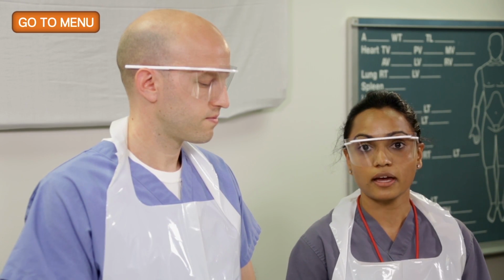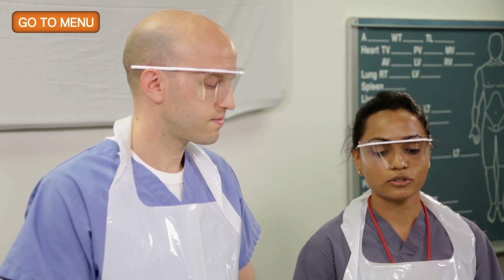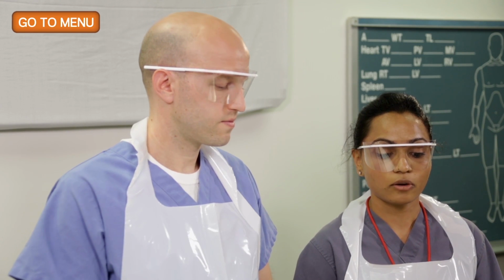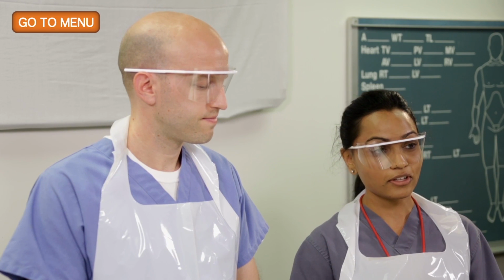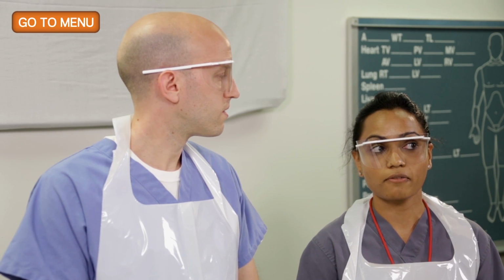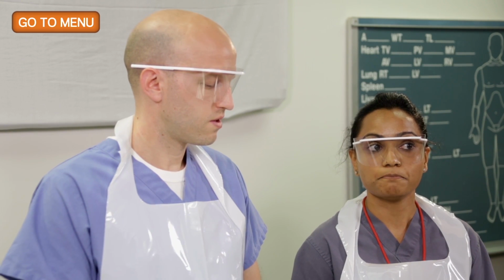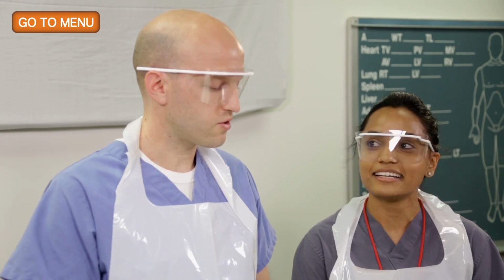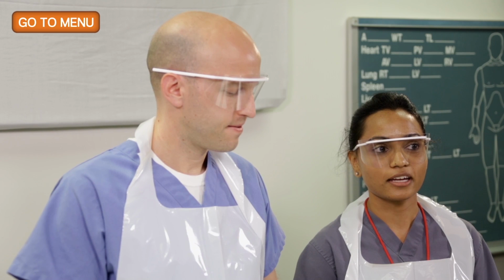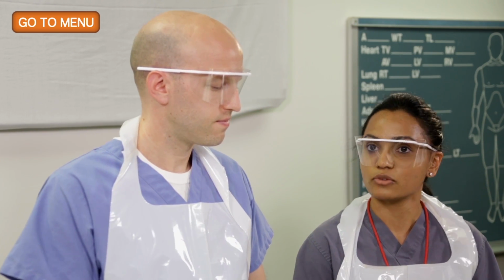Versus in a patient that has a history of coronary artery disease or hypertension, we usually bread loaf the heart so that we can evaluate the myocardium and look at the thickness of the ventricle. And then also we want to thoroughly evaluate the coronary arteries, so we dissect them entirely and take them out. We decalcify them if necessary, and then section them at 2 to 3 millimeters so that we can really evaluate the degree of stenosis.